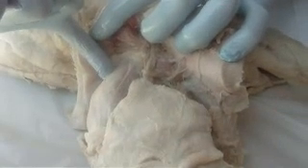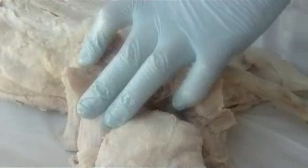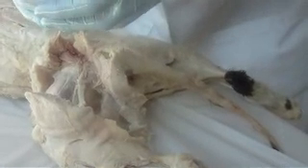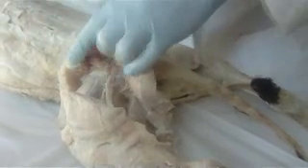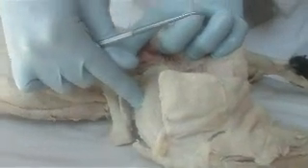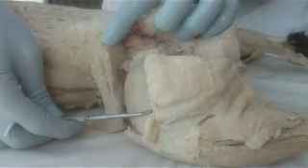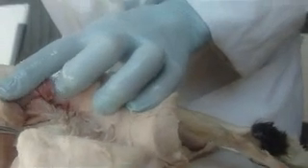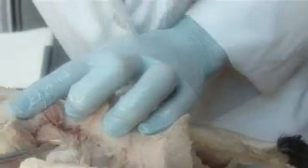When you find the top of the thigh, it's important to figure out where the head of your cat is. If the head is up here, the top of your thigh is at the top. It's easy to get confused in here, so rather than automatically focusing on what's pinned, pay attention to where your cat's head and butt are. To find where you need to start, find the top of the thigh — this is your vastus lateralis. Start at the top of your vastus lateralis, follow it down, and you reach your gluteus minimus. Then you have gemella superioris.